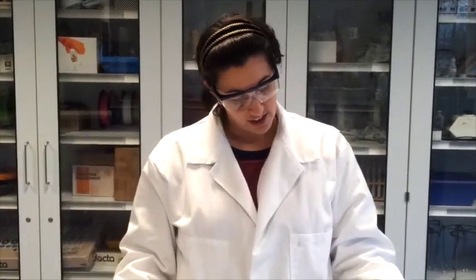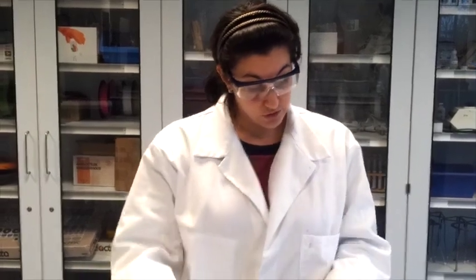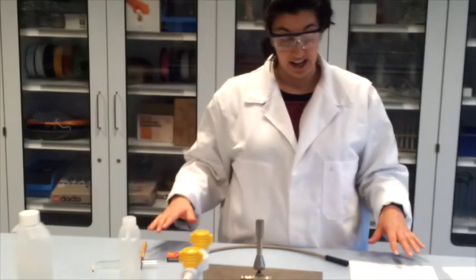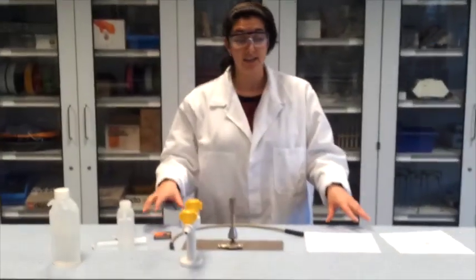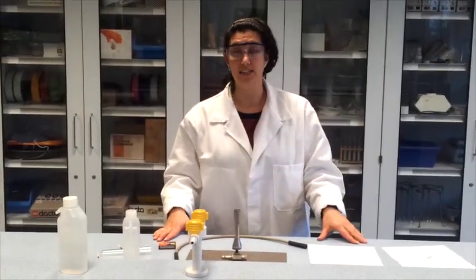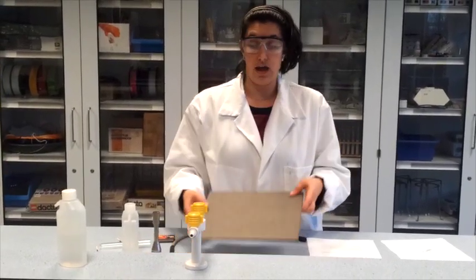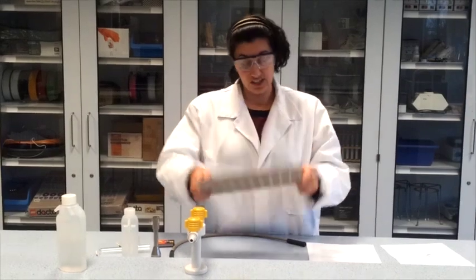Furthermore we need some matches. How are we going to do this? First of all we need to check if the Bunsen burner is positioned on a heat resistant surface. The tables in the science lab or in the classroom are heat resistant. If you're not sure you can use a heat resistant mat or a tile.